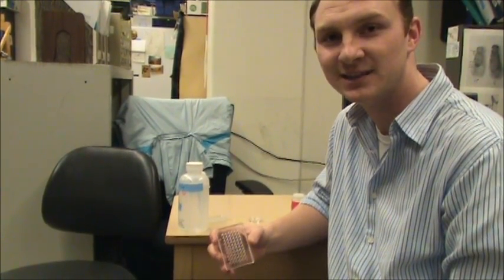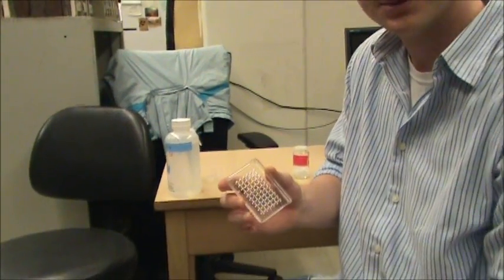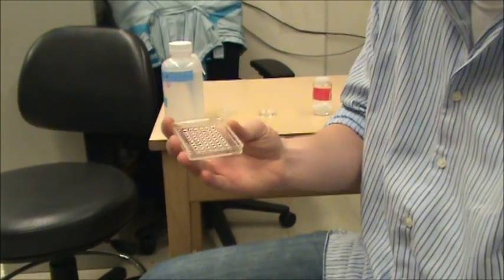So we've desheathed our ganglion. Now it's incubating in collagenase and dispase to sort of remove the connective tissue between the axons and let the cell bodies come out a lot easier. So we'll aspirate those cells and then place them into our microwell dish.